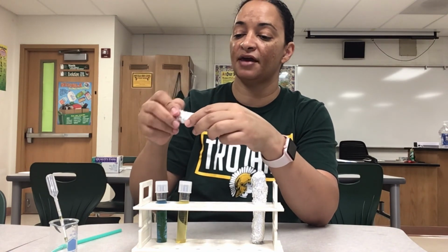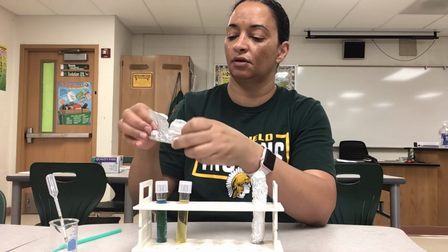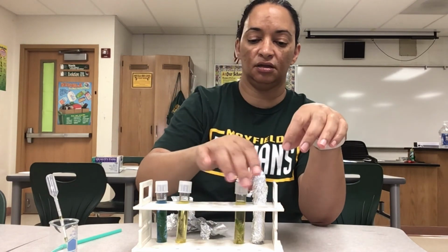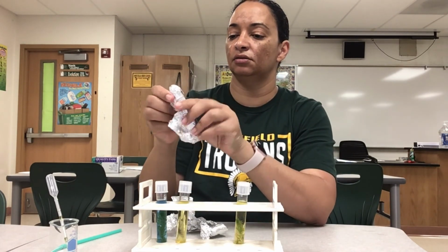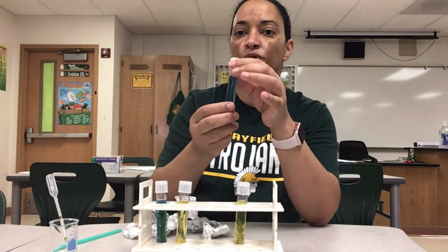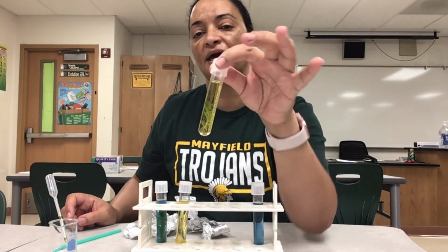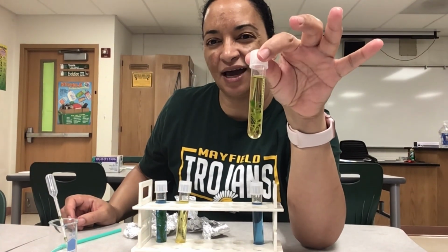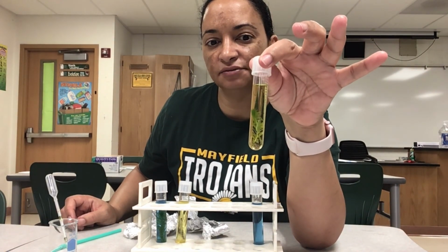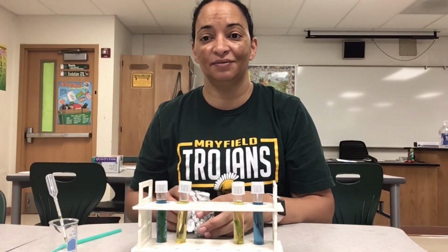So over here, I'm going to unwrap these two tubes that have been in the dark. And let's see what happened there. Unwrapping. Oh, okay. So I got a yellow tube, and let's see what's going on in this one. So my control tube started off blue and is still blue, but my experimental tube started off blue and now it is yellow. So what happened in this tube that caused it to turn yellow? Good questions. So let's go ahead and analyze our data and see what we come up with.